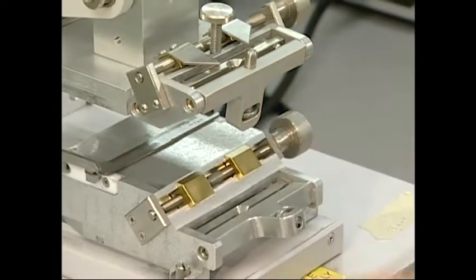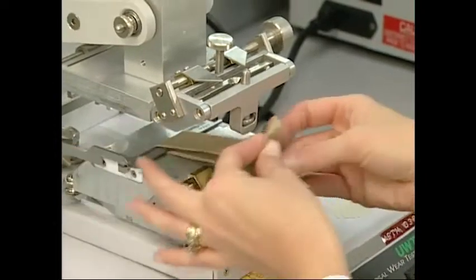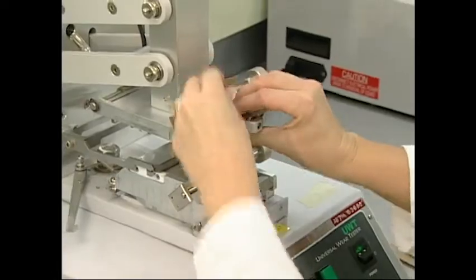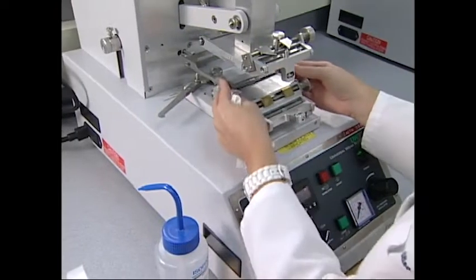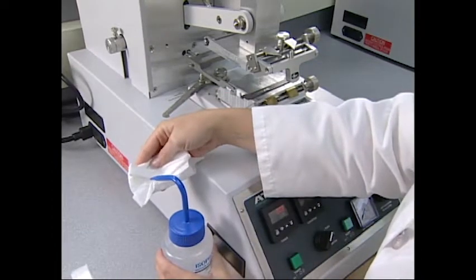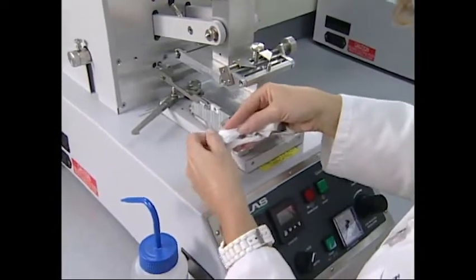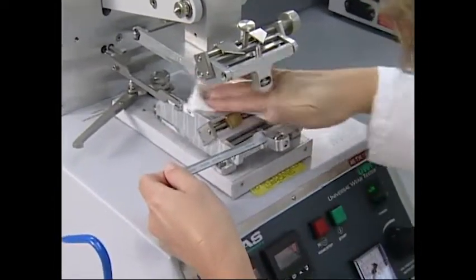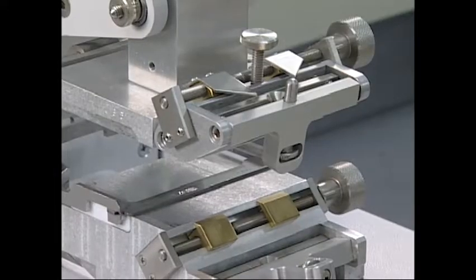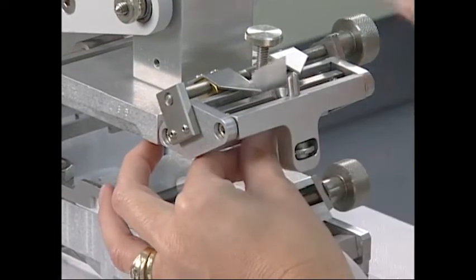The abradant bar used for the test is considered a permanent abradant and is made of a hardened metal. It is assumed that the abradant will not change appreciably in a specific series of tests. However, the bar's abrasive properties can be affected and even change due to the pickup of materials during testing, including chemicals and other material deposited from contact with the test fabrics. As a result, the bar should be cleaned with alcohol as needed. The abradant bar must be checked at frequent intervals using a calibration ribbon to make sure the bar is in good condition.